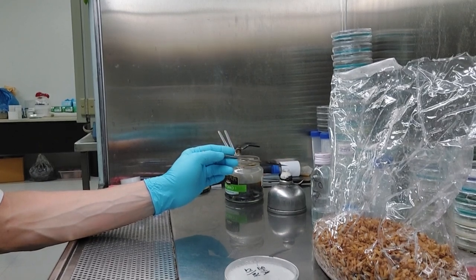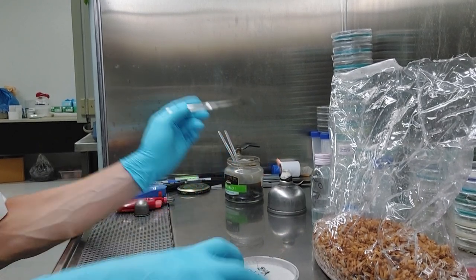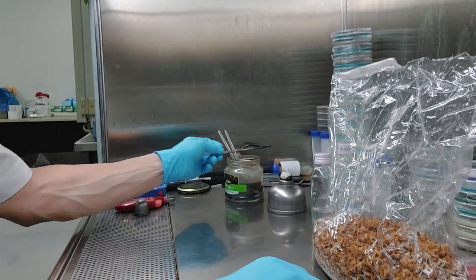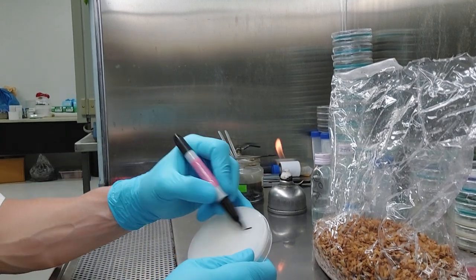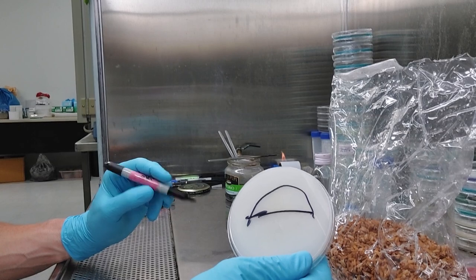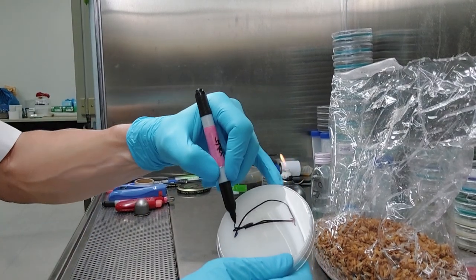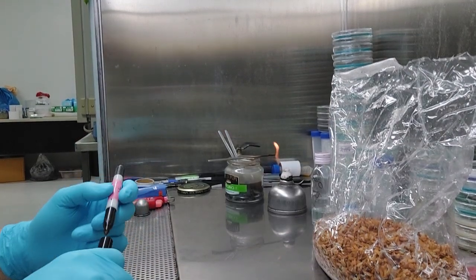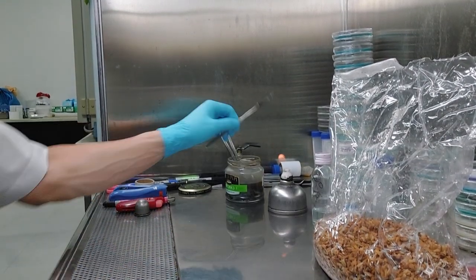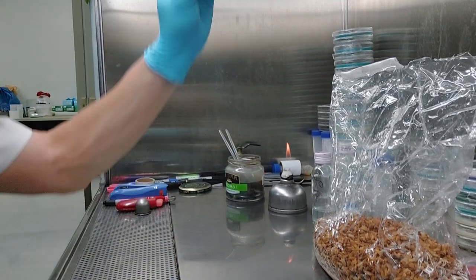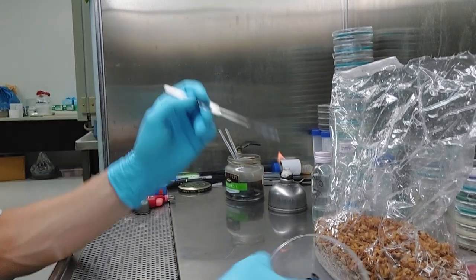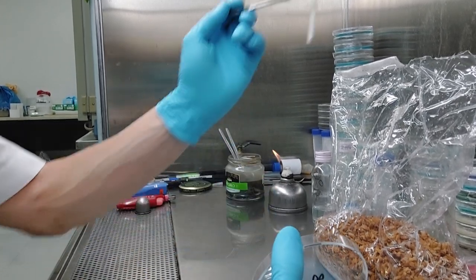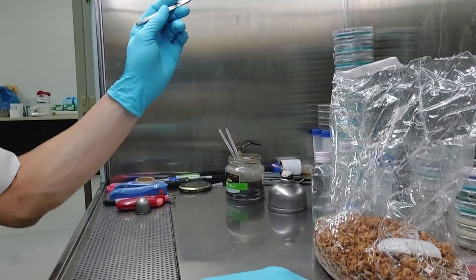Grab my other scalpel. That's a little bit cooler and you might want to open this a little bit here. I don't know how well you're going to be able to see as I'm kind of running out of room. I'm going to cut again. I don't use the whole plate. I am a little bit concerned, if not even bothered by the people that put the whole plate in near the edges of the plate is where the contamination is. I'm going to only grab, let me just draw real quick on the bottom. I'm only going to grab like half of that plate. I'm basically going to grab like half of that plate and I'm going to do it with a cool down scalpel. Okay. So I'm going to inoculate my spawn. Close my plate.